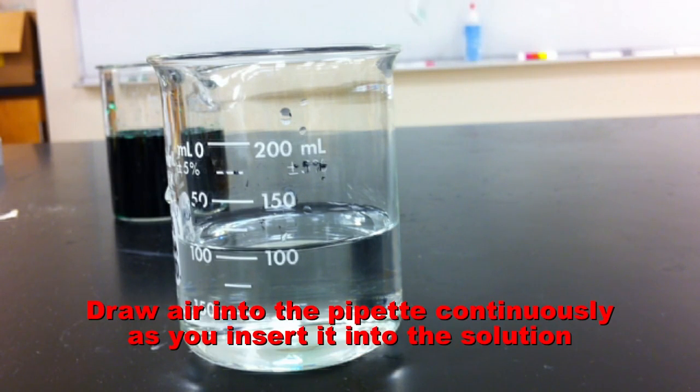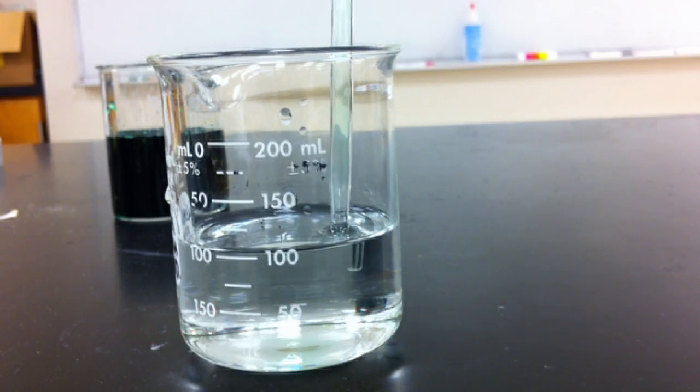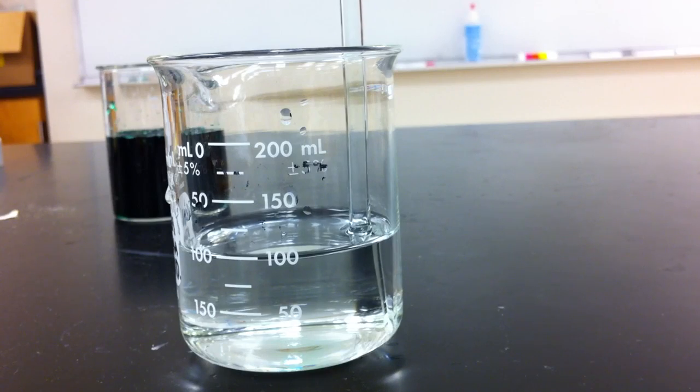To avoid contamination, draw air into the pipette continuously as you go to insert it into your solution. This will pull the droplet upwards and prevent it from going back into the solution that you are aspirating.